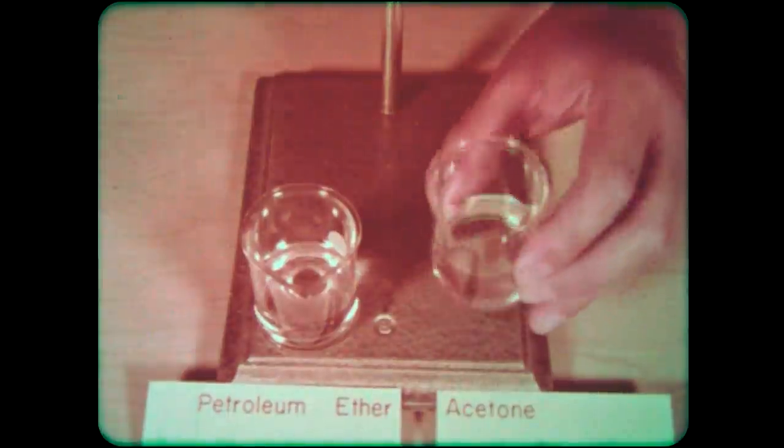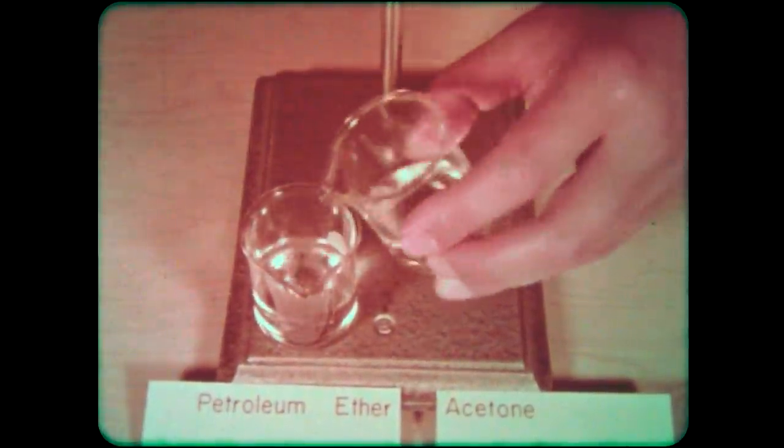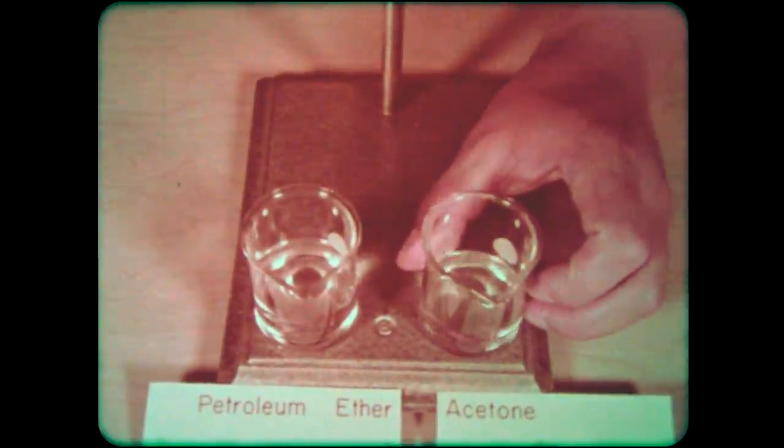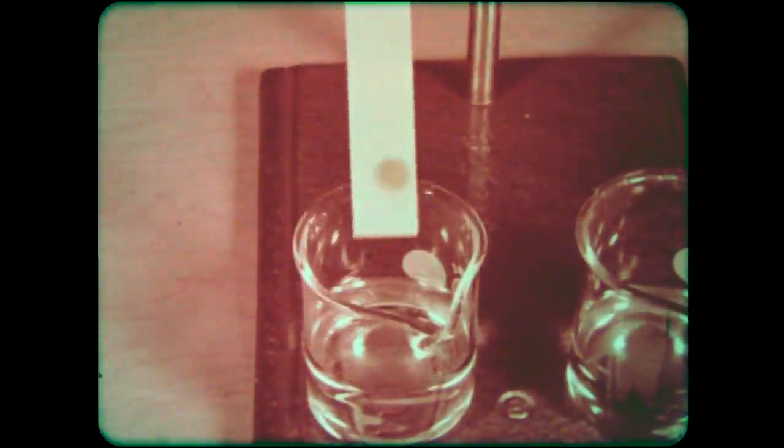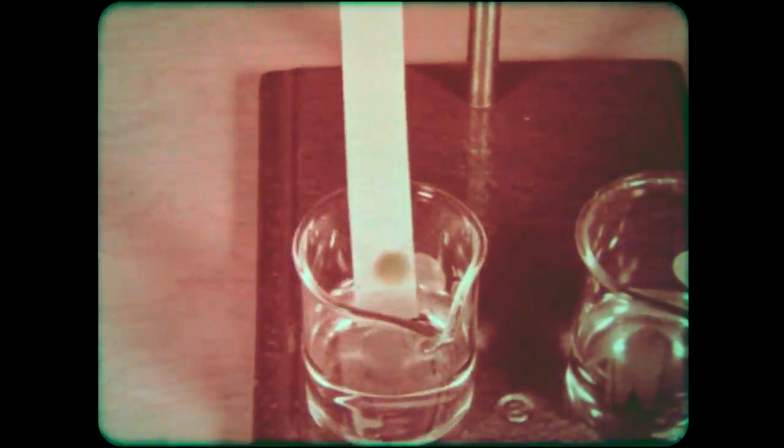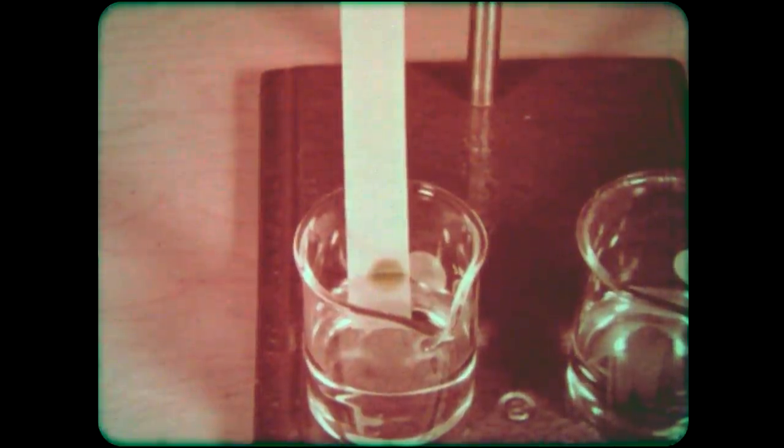Combining the two solvents should give even better results. The action has been speeded up three times here by the camera.